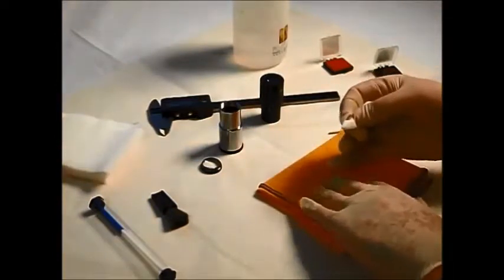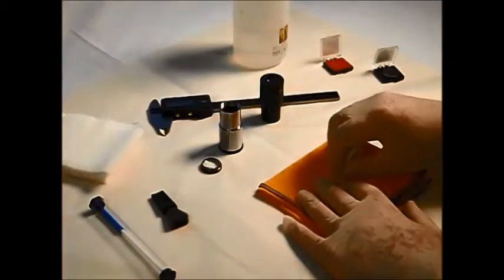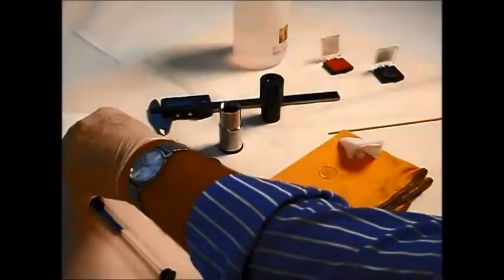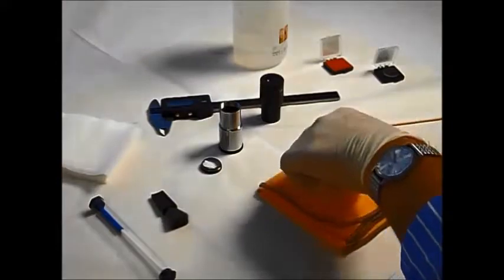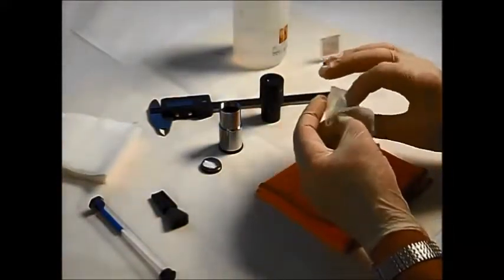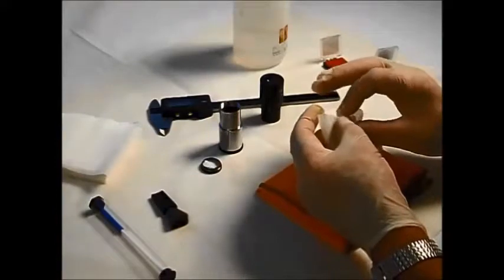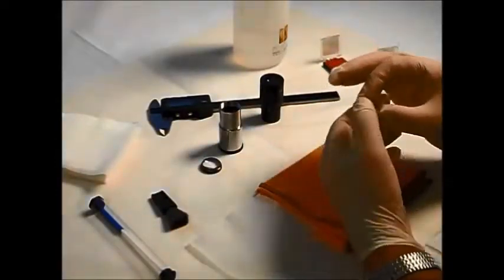Now, similarly, you do this on the reverse side. Move to the outside edge. Finally, just give that a bit of a clean polish and dry, like this. It's important to make sure it's dried properly, otherwise if the fluid dries wet on the glass, you get a sort of watermark or cleaning fluid mark on there. We don't need that.